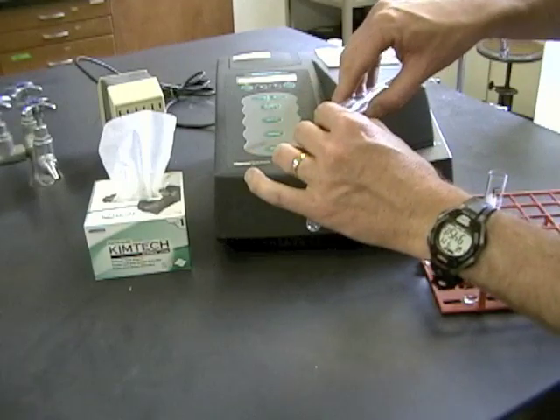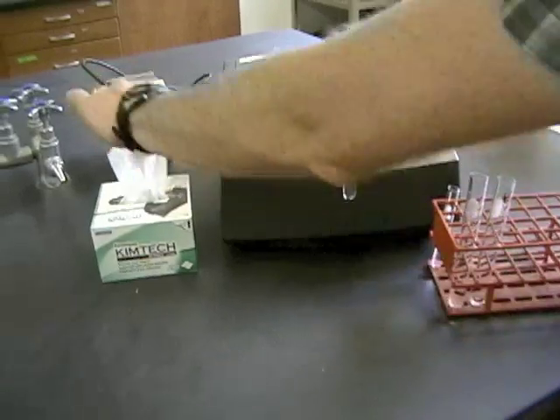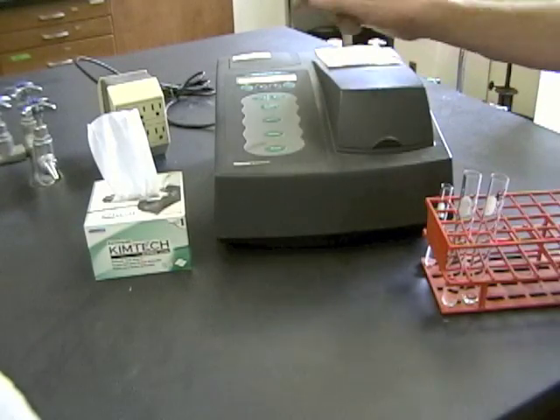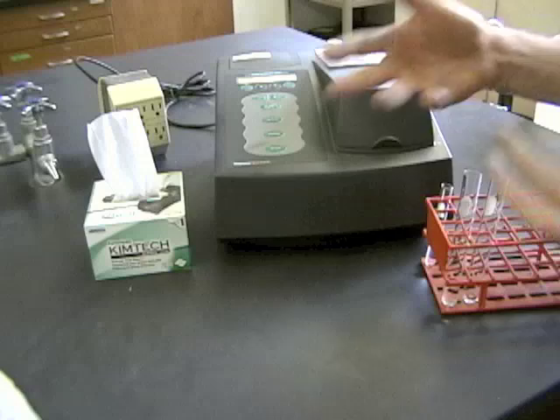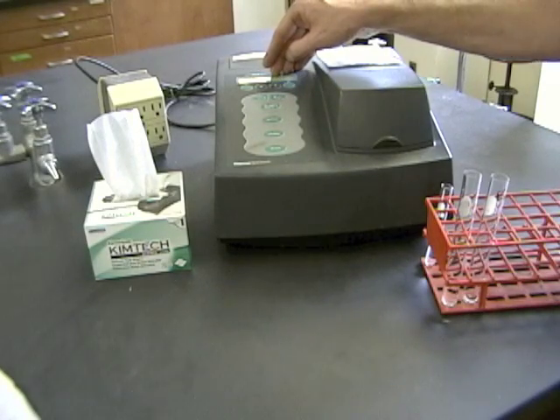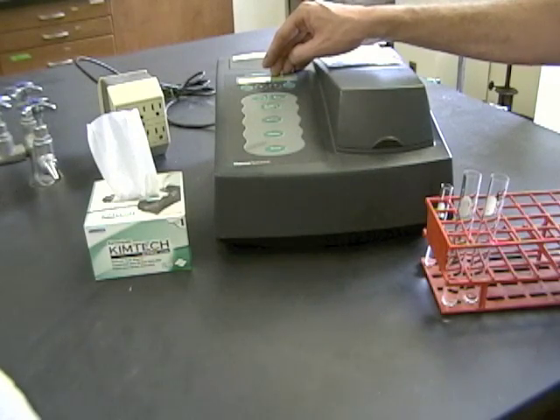Then I'm going to fill up my spectrophotometer tube about halfway, wipe it off to make sure there aren't any fingerprints on there, put it in and go. One thing you'll notice is that the numbers on the spectrophotometer are not going to stabilize and level off. That's because the reaction is actually going on — more of that amber-colored product is being produced all the time. So don't wait for the numbers to stop moving; they're going to keep changing. Just take the numbers when you get to each time point.